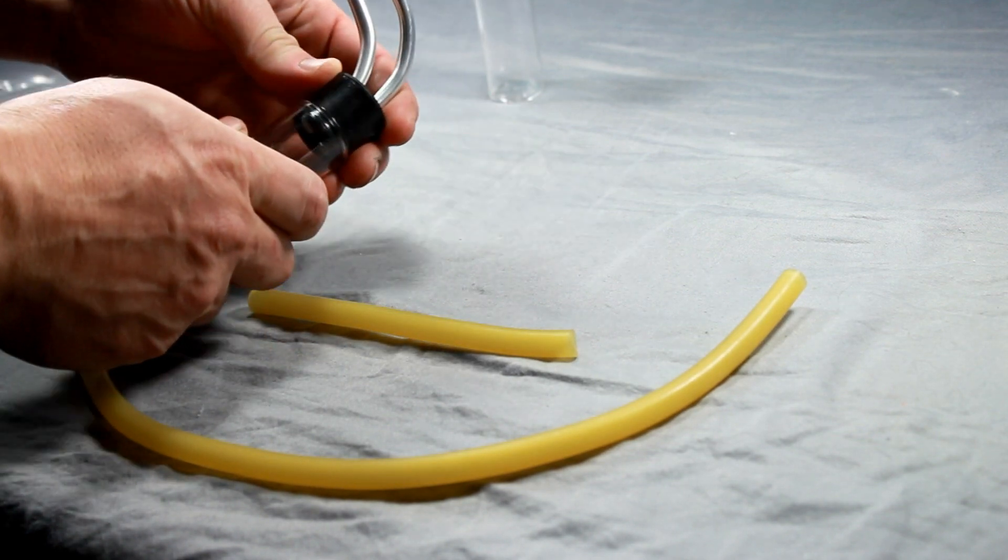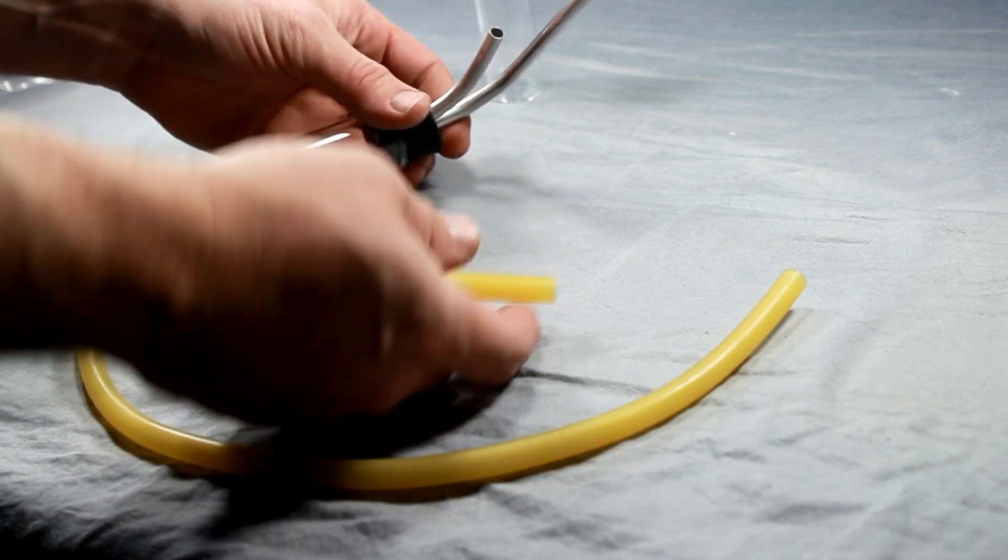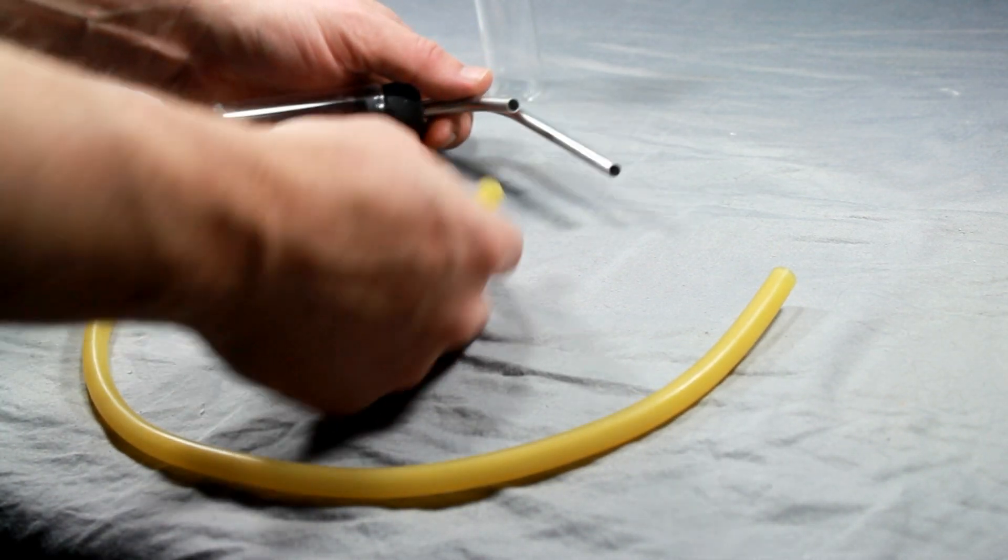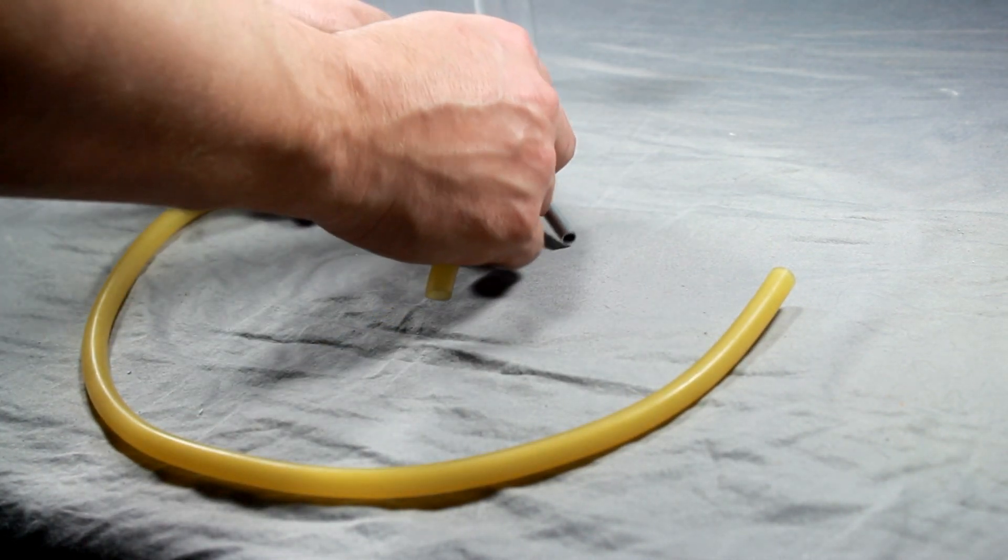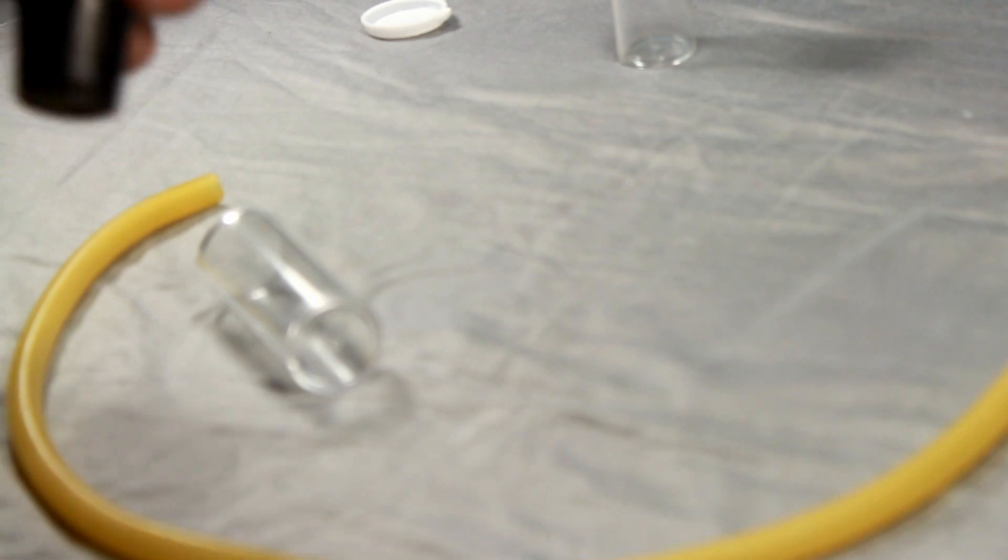You have an extra vial once you fill ants up inside of the first vial. So you want to go ahead and connect the short piece again to the short stem. A good six to eight inch piece so you can hold the vial with your other hand.